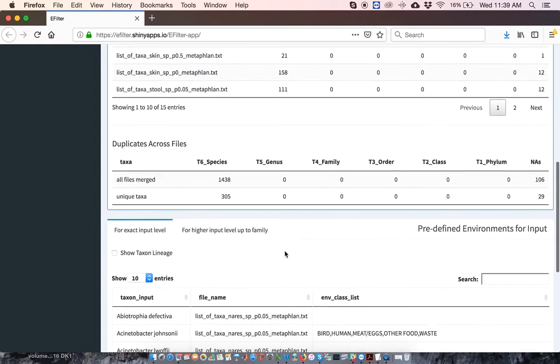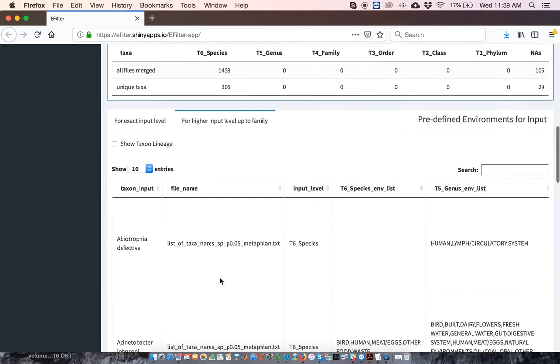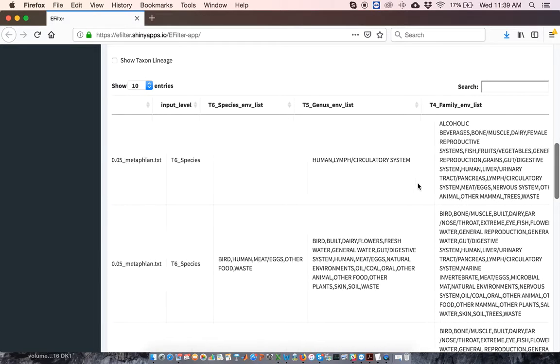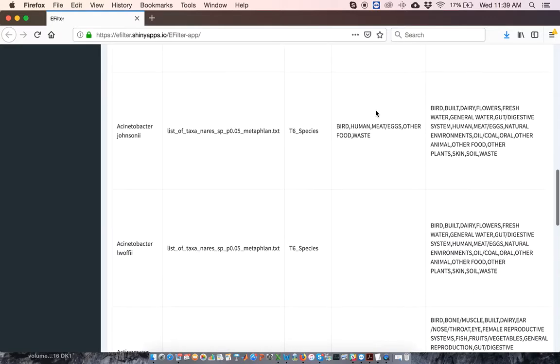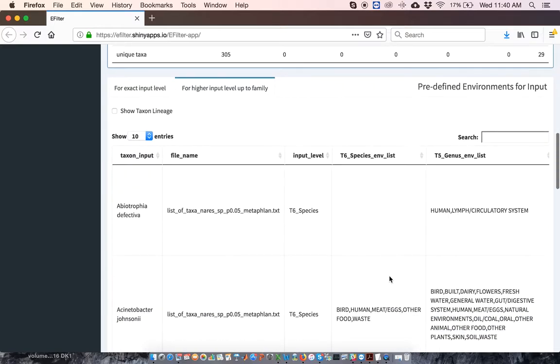The next thing that you'll find is a list of all of the taxa, along with the known habitats for each. So for instance, for Abiotrophia defectiva, we don't have any recorded habitats. However, for Acinetobacter johnsoni, we have this taxon recorded from a variety of habitats, including birds, humans, food, and waste. Habitat information is presented for the input taxonomic rank and also for higher taxonomic ranks. Here, for example, we see habitat information for genus level and for family level for our list of species. Not surprisingly, habitat coverage for species is somewhat spotty. It becomes much more complete for genera and for higher taxonomic ranks.